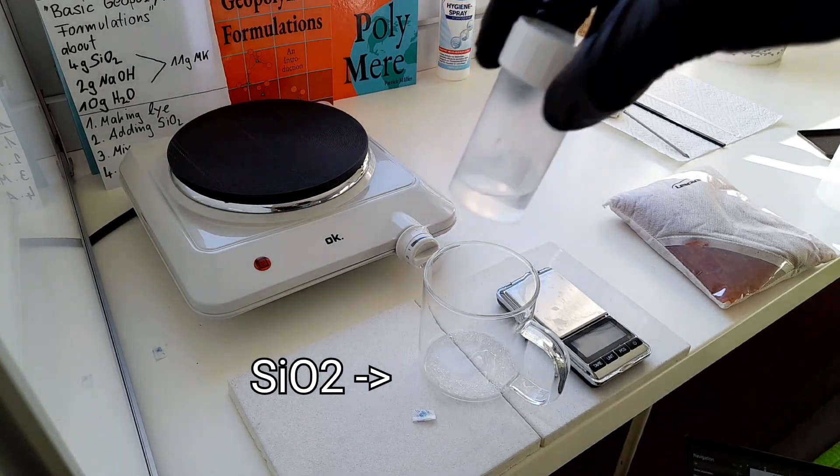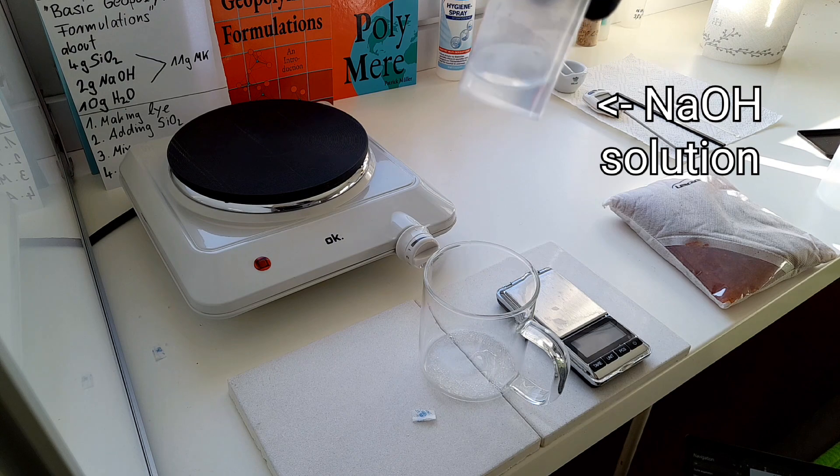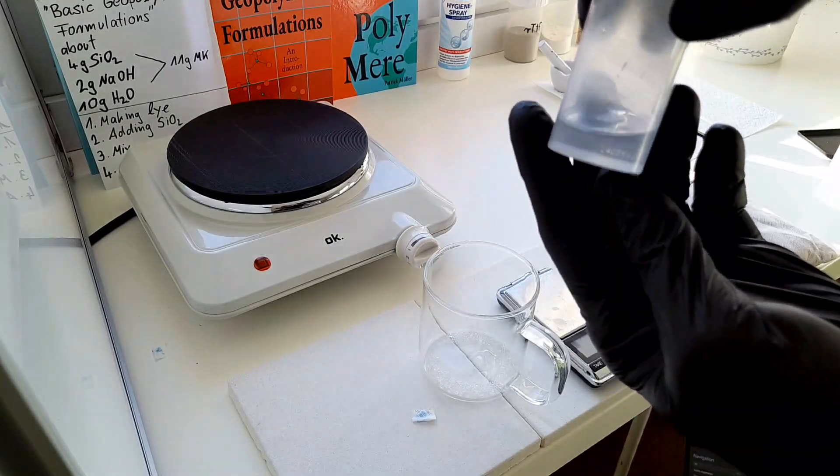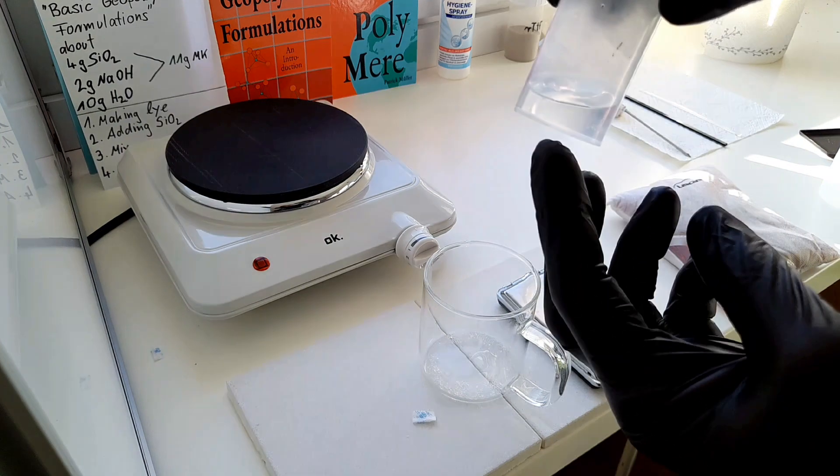You see our sodium hydroxide lye solution already became clear. If you use bigger amounts, then this is more difficult.